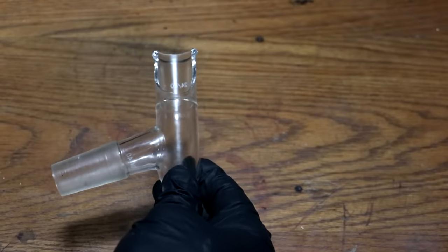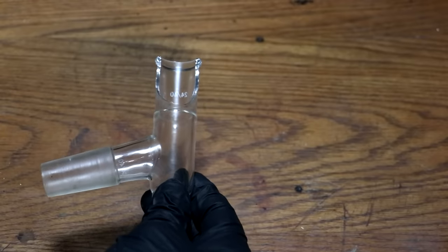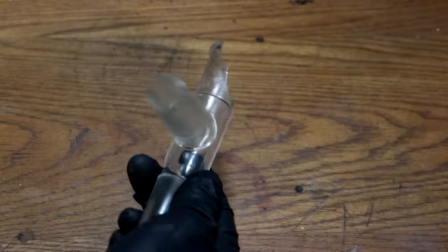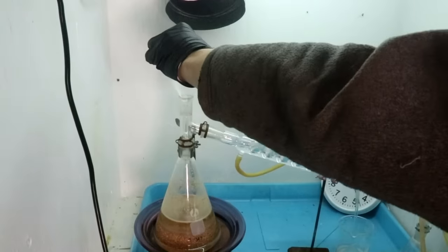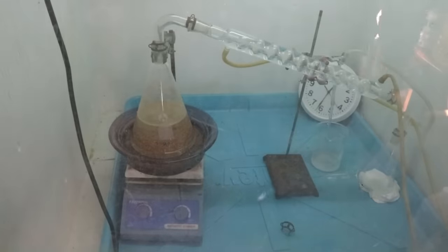Now I think the reason for that is this is actually a smooth-sided fitting meant for a cork, and I thought it was a ground glass fitting. I mean, it looks like it should be a ground glass fitting, right? But that's not ground glass right there. Some people did notice that I changed distillation adapters between cuts, and this is why.